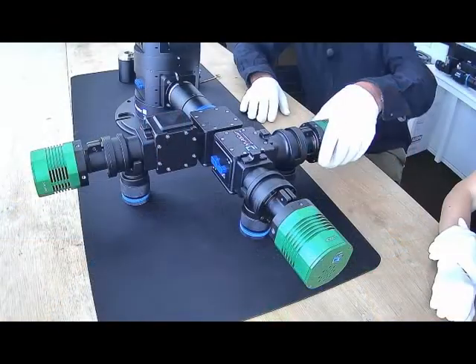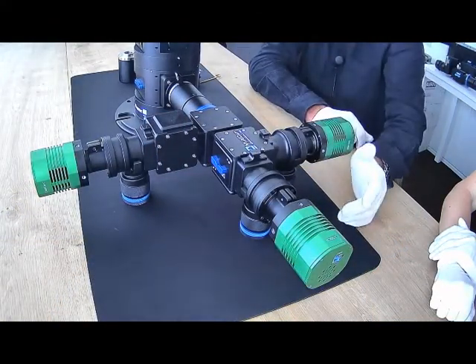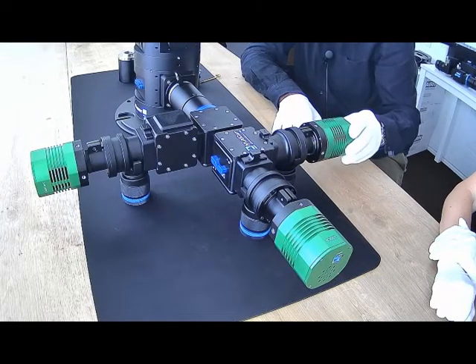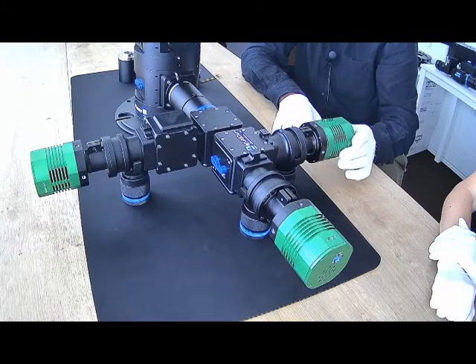So on this configuration, this could actually be set up for 4 cameras. At the moment we've got it set up for 3, so this is what we would call a triple cam configuration, and these cameras are actually a camera that we've developed recently and will be launching very shortly. They've already gone out to a lot of early adopters and have been very well received.